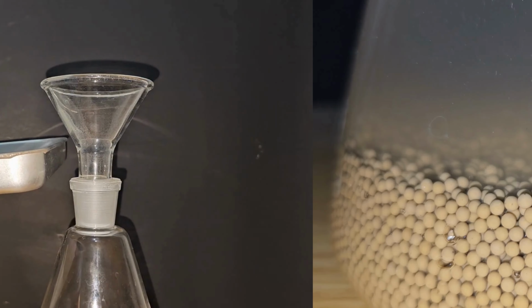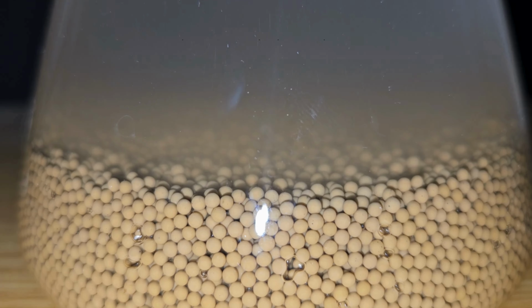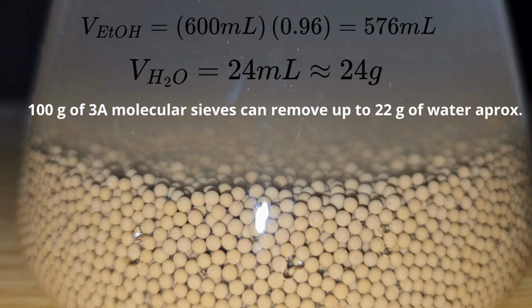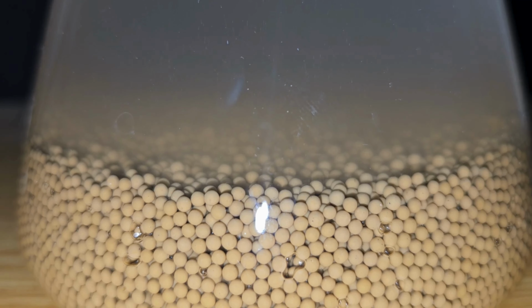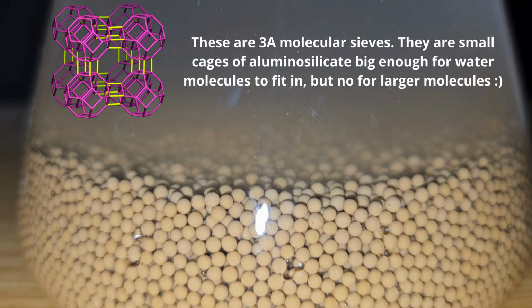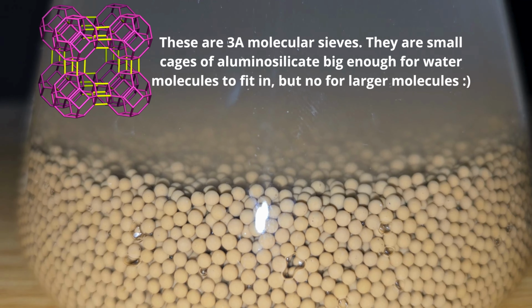Molecular sieves can remove up to 22 grams of water per 100 grams of molecular sieves. So in my case, I added approximately 200 grams, which is more or less double what I needed. These tiny bubbles you see are the sign that the molecular sieves are doing their job.